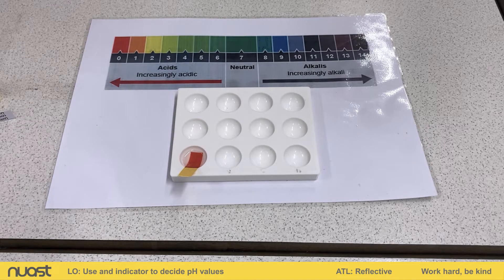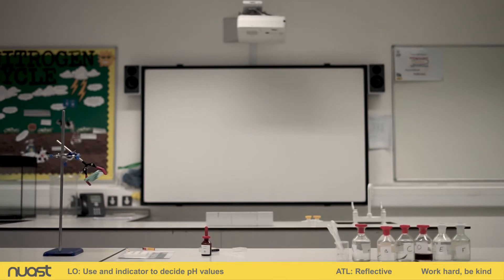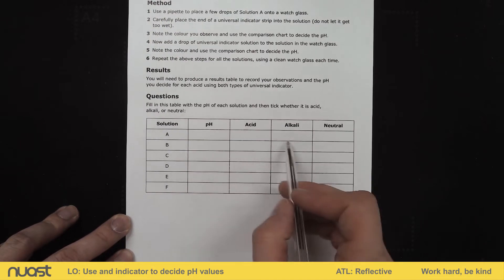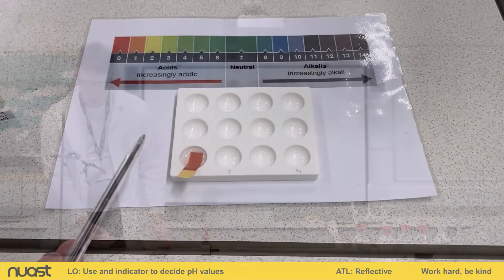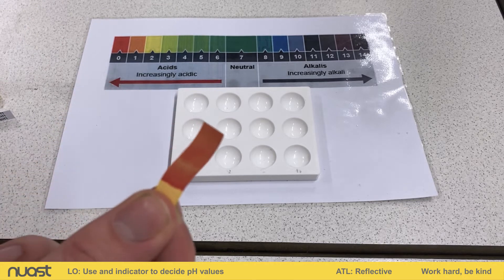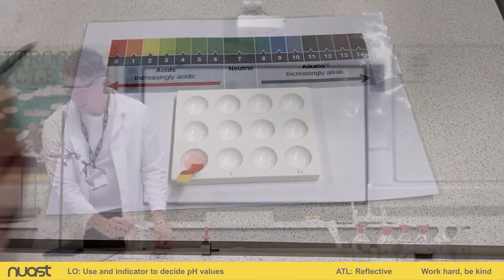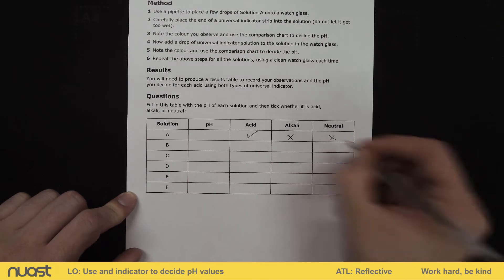Now we've added that to our solution, we're going to note the colour. So if we come back to our method, we've got solution A, we have pH, acid, alkali or neutral. We're going to determine whether it is an acid, alkali or neutral by looking at the colour. We formed a reddy-orange colour on the universal indicator paper, and the red-orange would suggest it is an acid. So we can identify it as an acid — it is not an alkali and it is not neutral.